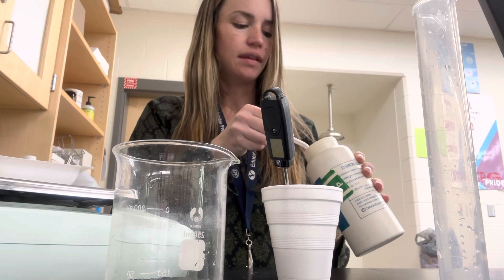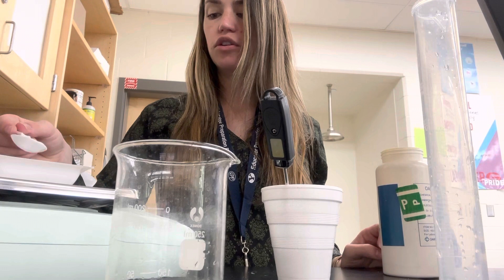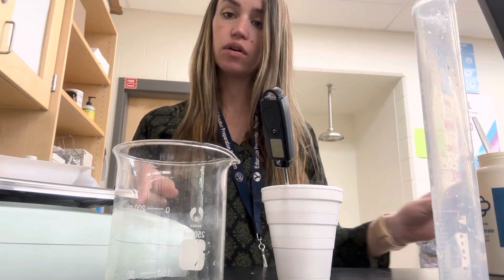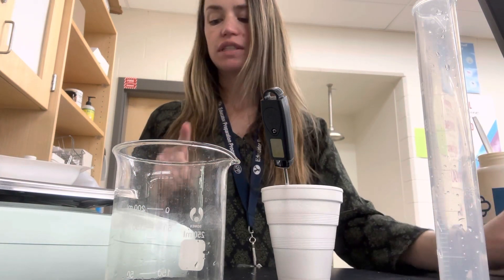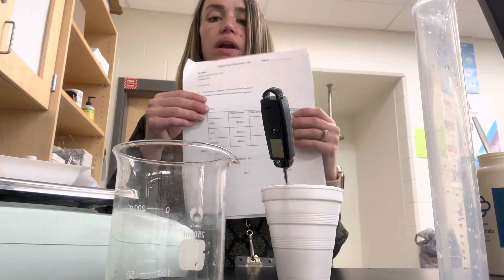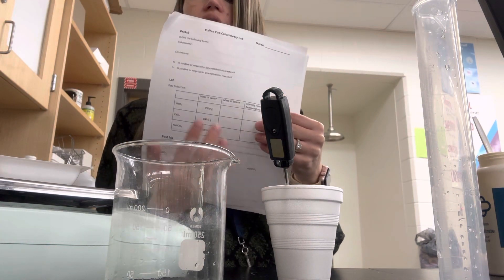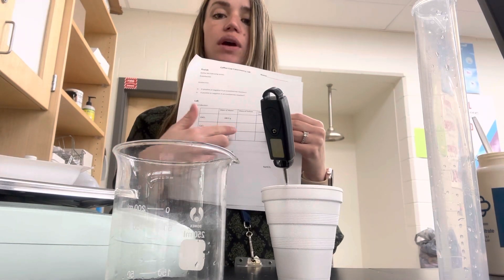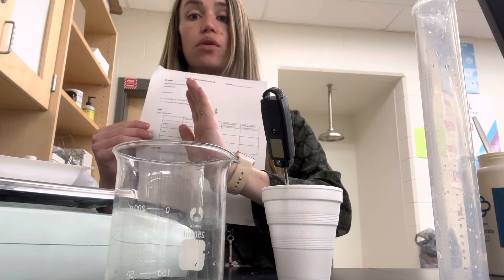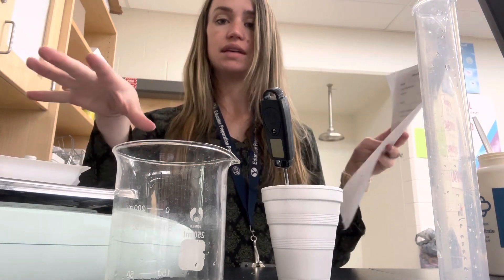You may need to add some and then take some away until you get to one gram. It doesn't need to be exactly one — just take whatever number shows on your scale and write it on your lab report. For example, right now it says 1.04, which is really close to one, so I'll leave it. On the data table where it says mass of solute in the second column, write exactly what it says on your scale. Make sure you're at one gram or a little over, not under. So I would write 1.04 on my paper for this solute.